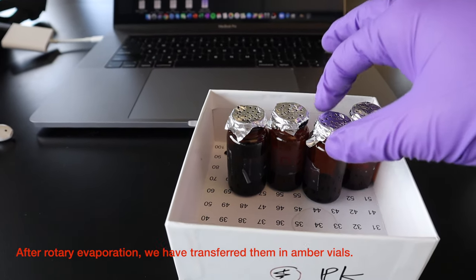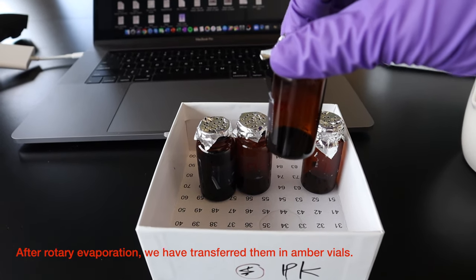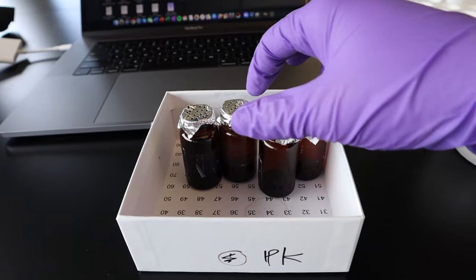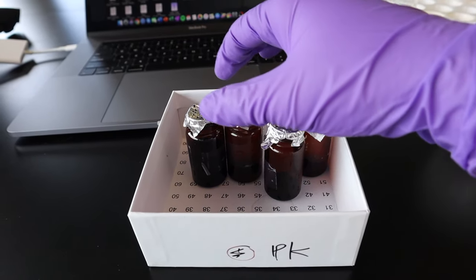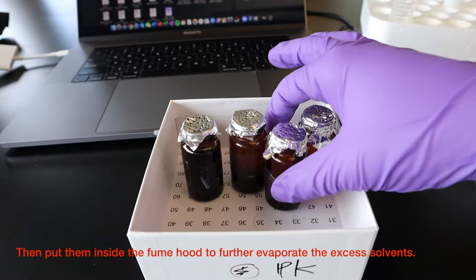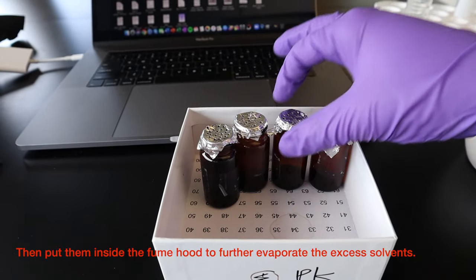After the evaporation, they transfer it in a vial and we will evaporate it right there.